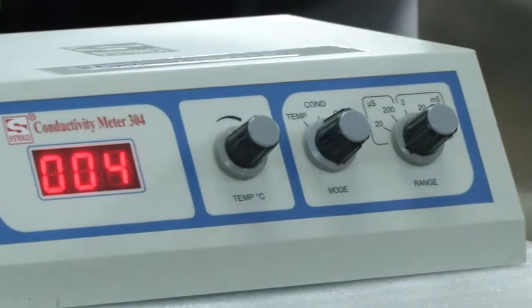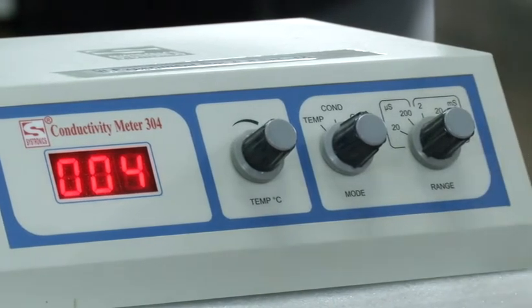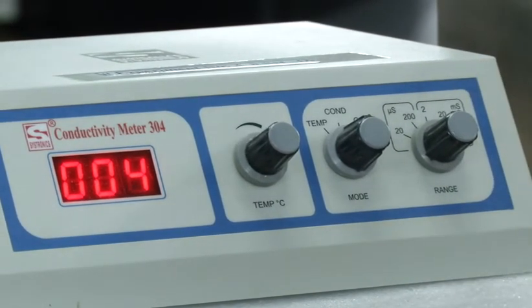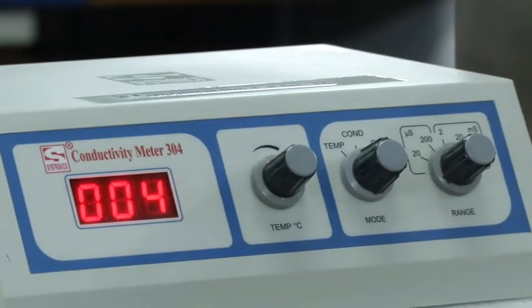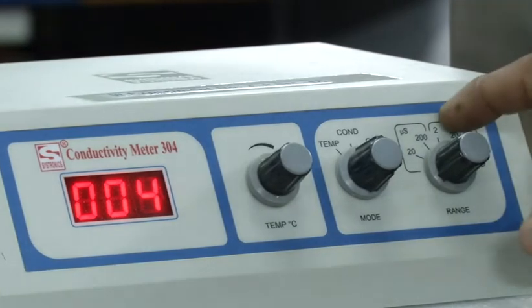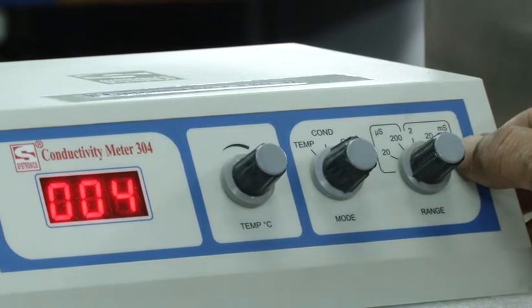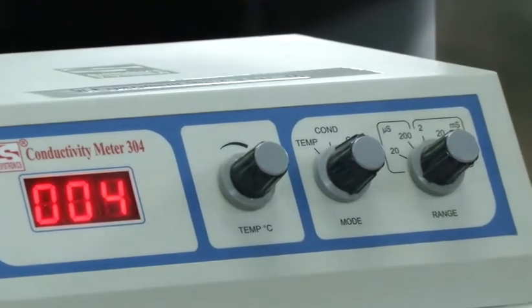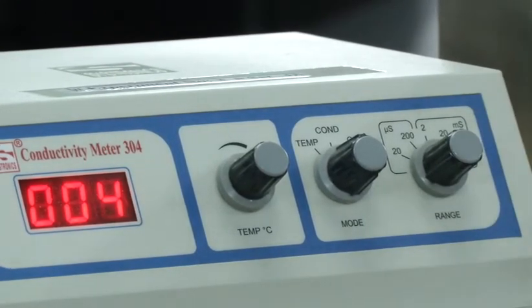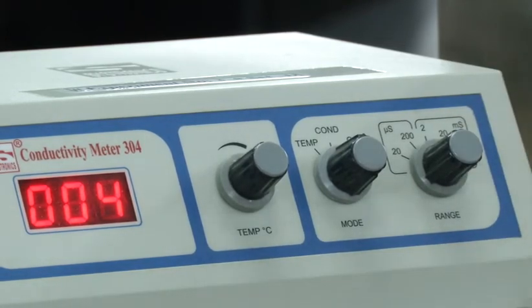If the conductance is less than 2, then 2 will be the best place where you can place this switch, because keeping it on 2, you can get 2 decimal places. So if the reading is 1.81, it is less than 2. Keeping this switch on 2, you will get that reading. But you can't get the reading keeping this on 200. On 200 it will show either 1 or 2, no reading in between. On 20 it will show 1 decimal place. On 2 it will show 2 decimal places. So if the reading is 1.81, 2 will be the best place out of these 3.